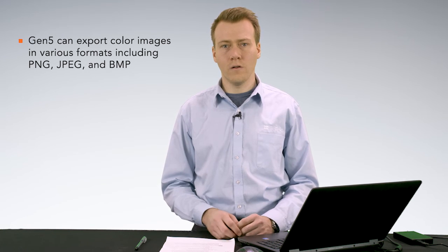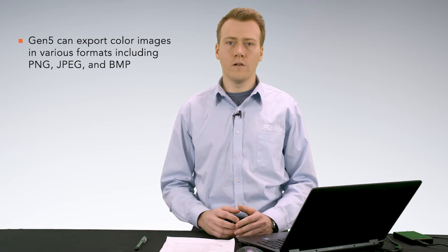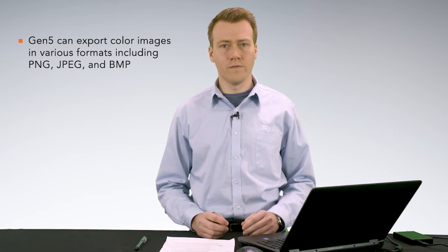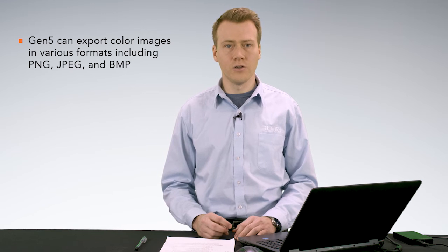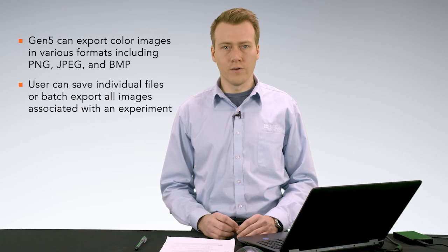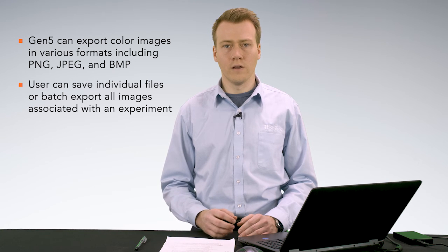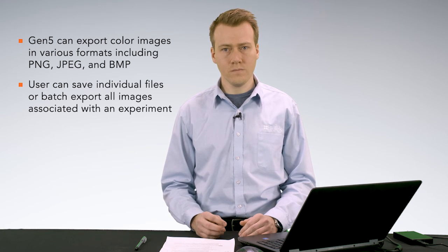In addition to grayscale TIFFs, Gen5 allows the user to export color images for presentation and publication purposes. These color images can be saved in a range of file formats, including PNG, JPEG, and BMP. The user can save individual files, or they can use the batch export feature to export all of the images associated with a Gen5 experiment.